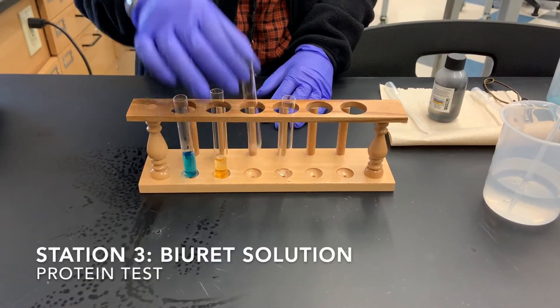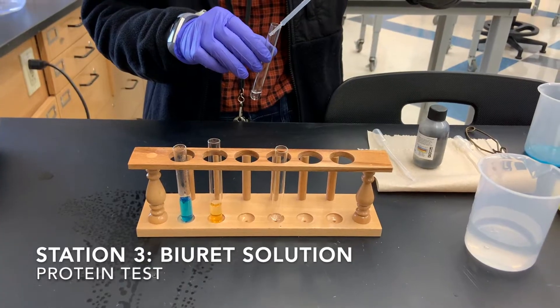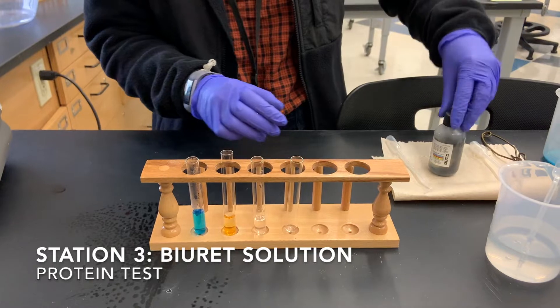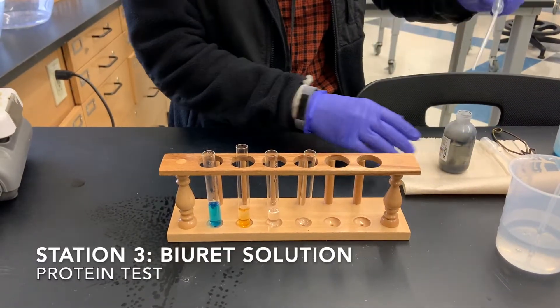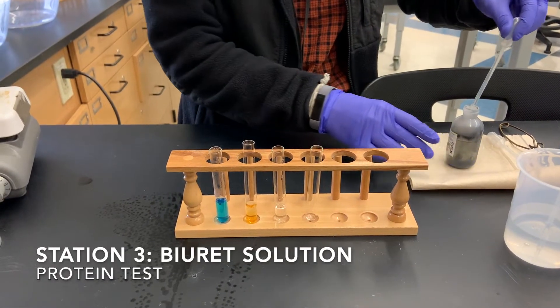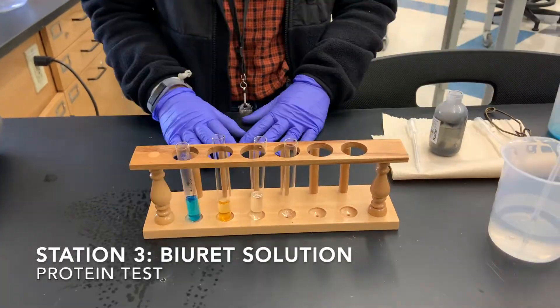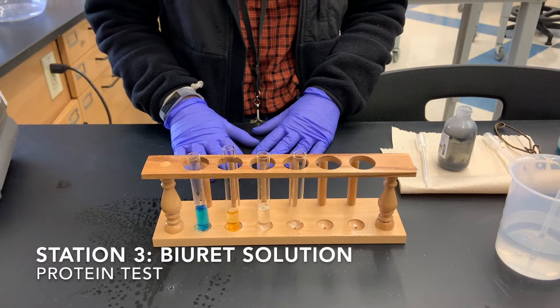Now we are going to do our third control test. We are going to use two milliliters of water again in our test tube. And now we are going to use one milliliter of biuret reagent and put this in our water. We see the solution is still clear. In the presence of proteins, this solution would be a purple-brown color, but we can see that it's not. So that's good because it's just water.